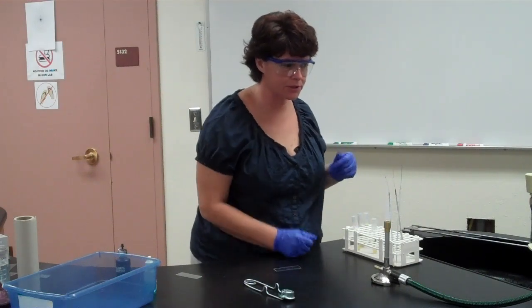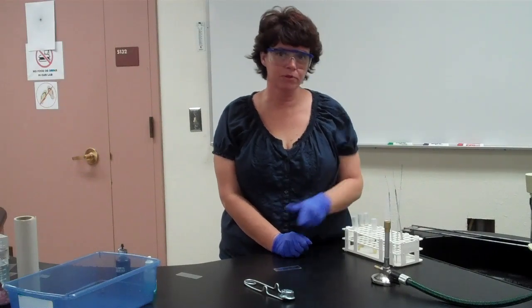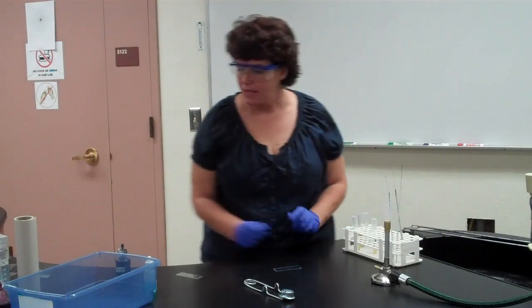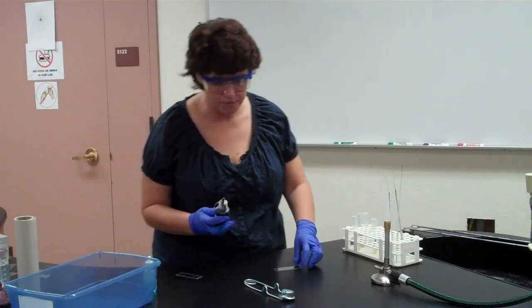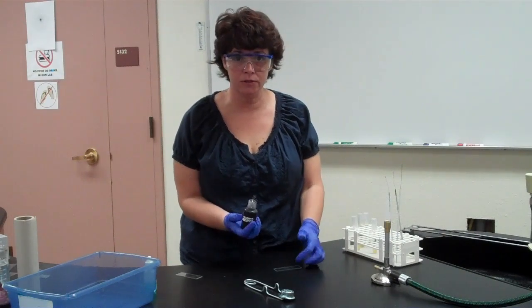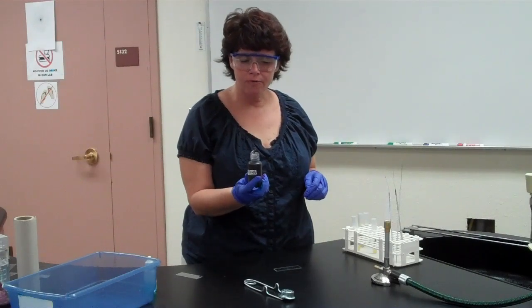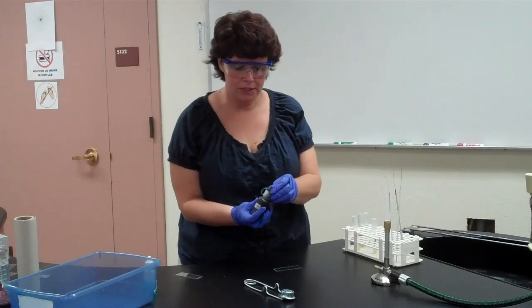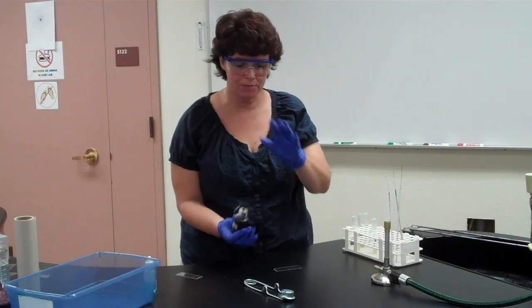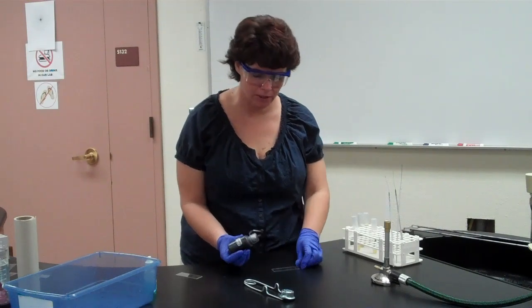I'm using a different Bunsen burner than some we've seen in class — I prefer these; you get a nice blue cone. With the capsule stain, the first thing to do is add a few drops of crystal violet directly onto the slide — don't use the loop. Crystal violet is the primary stain of the Gram stain, but here instead of putting it on a fixed smear, you put the crystal violet on the slide before you add the bacteria.